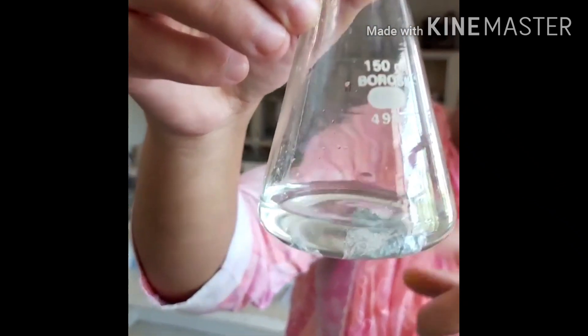These bubbles are coming out — these bubbles are of hydrogen gas. The reaction between zinc and acid produces a salt and hydrogen gas.